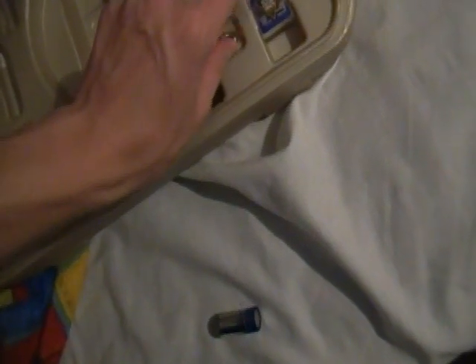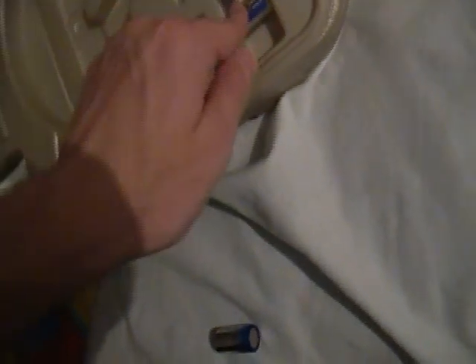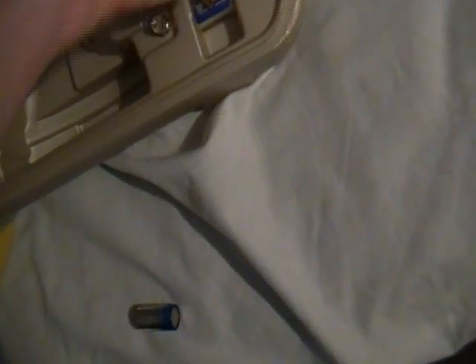The microscope itself, a spare light, which I believe actually still works. Cover glasses for the thing here, the slide that I broke years ago. A prepared slide, two of them. One of them is glass, one of them is just a piece of plastic. And two collection vials for collecting crap. I don't know if this came with tweezers at one point. I believe it did. But, like I said, I have no clue. And that's what was included. Oh, and a magnifying glass, if I haven't said that already.